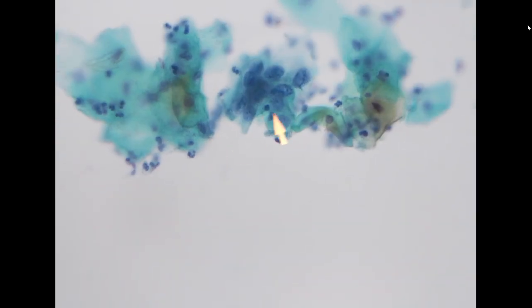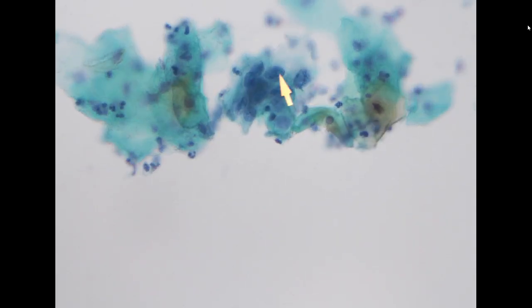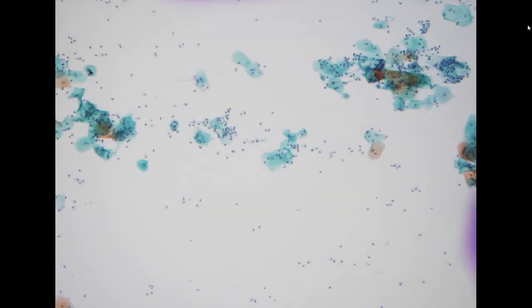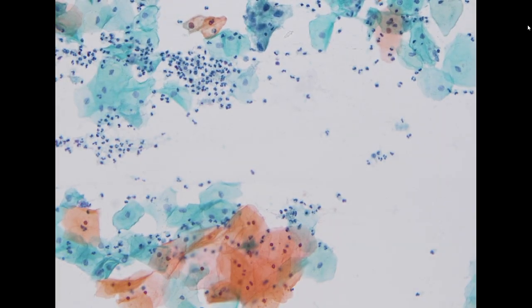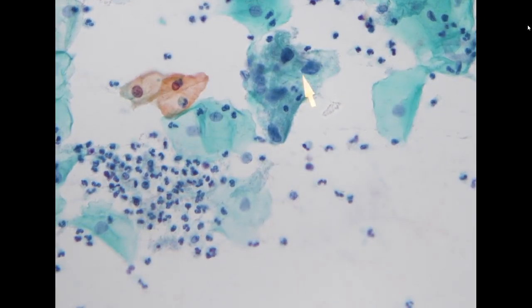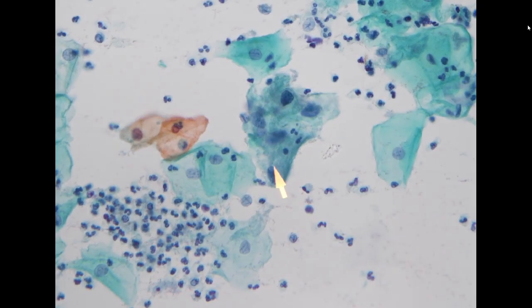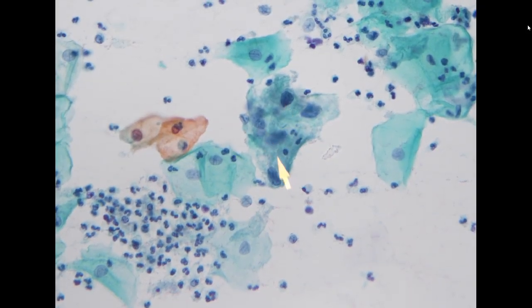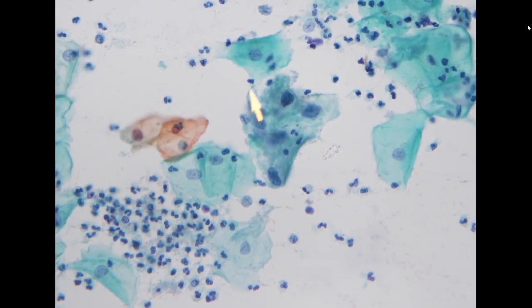So here we see some irregular cells with moderately increased nuclear to cytoplasmic ratio. The chromatin pattern shows a little bit dense chromatin, but to me, I think this specimen is a little bit difficult to appreciate. Definitely some metaplastic change. So in this cluster, comparing to the normal intermediate cell, it shows slight hyperchromasia, slightly coarse chromatin, but no pronounced increased NC ratio. The size of the nucleus is not markedly enlarged.